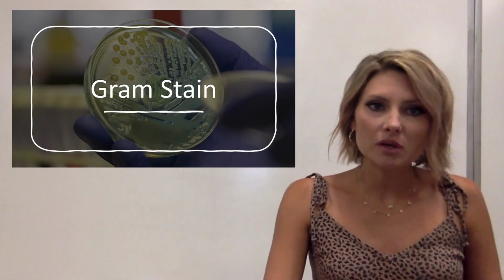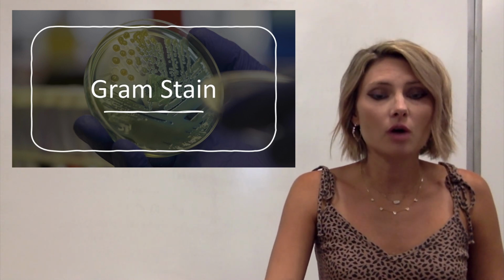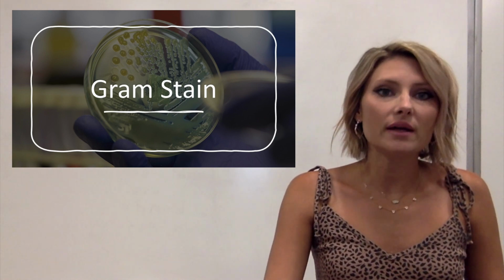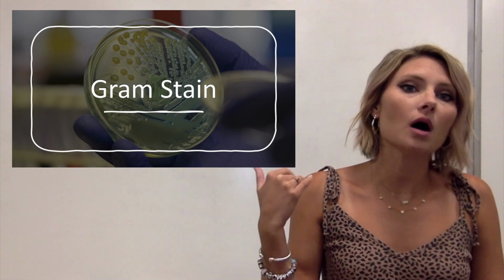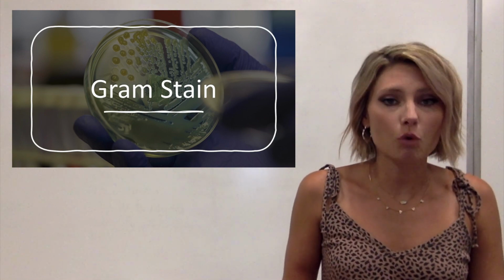Today we are going to be going over the gram stain and I will be demonstrating that for you. So we are going to go over the gram stain, what it is, why we do it. We're going to go over the steps first, so I'm going to go over each and every step and why each step is important, and then I'm going to demonstrate the gram stain for you.